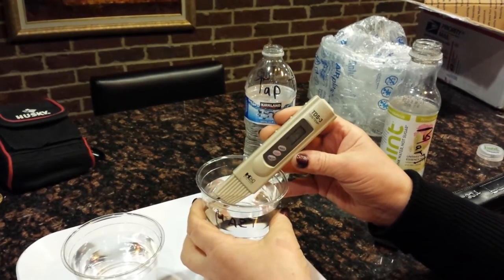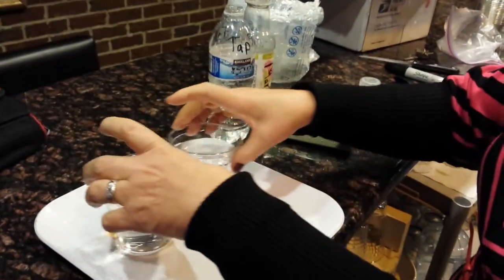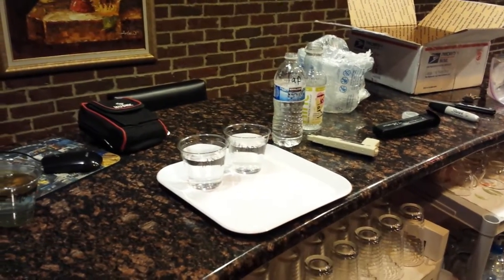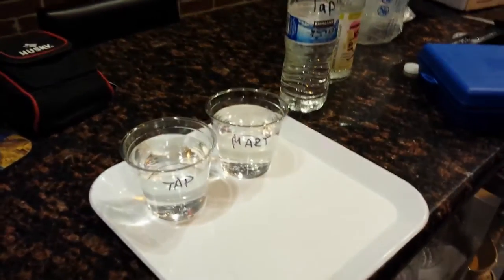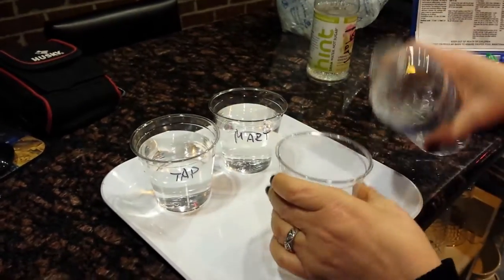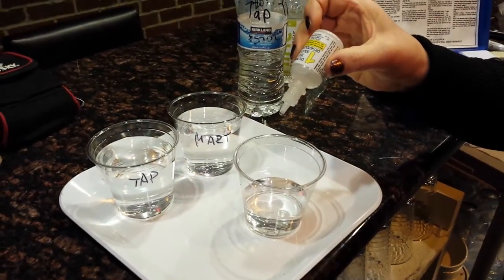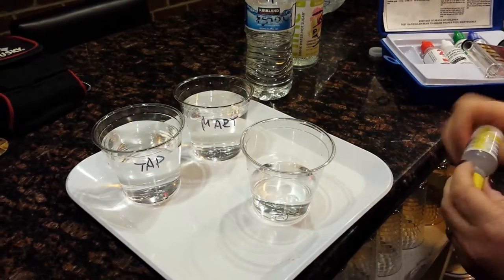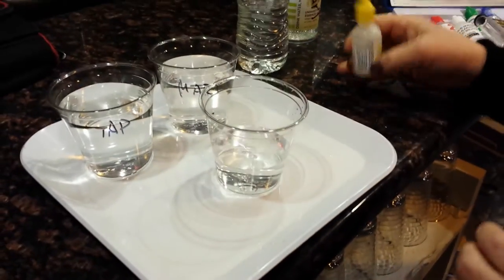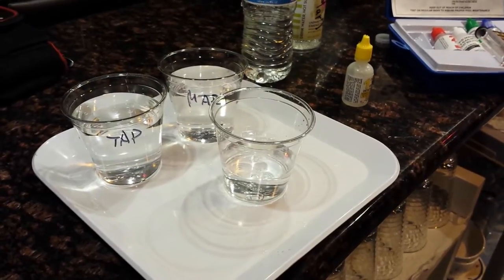Wow, 16, 15 — now what about chlorine? I wonder if they use chlorine in Arizona. Let's check — I don't know what water they have. Maybe they do. I've never been to Arizona because I hear it's very hot. We will see the tap water for chlorine — I put two drops of reagent in. Hmm, doesn't show. So no chlorine in there.